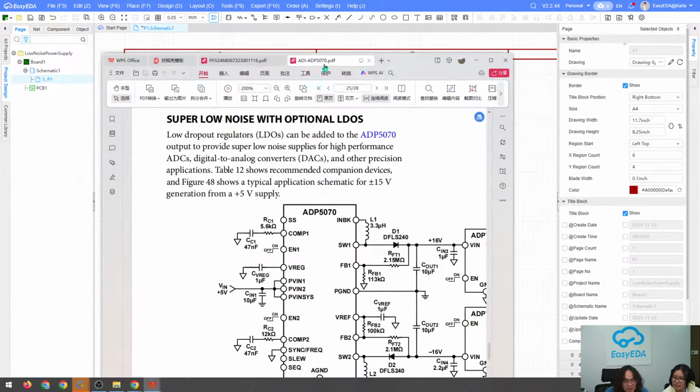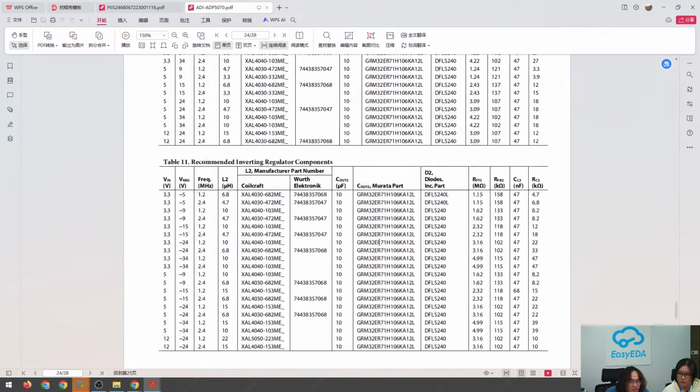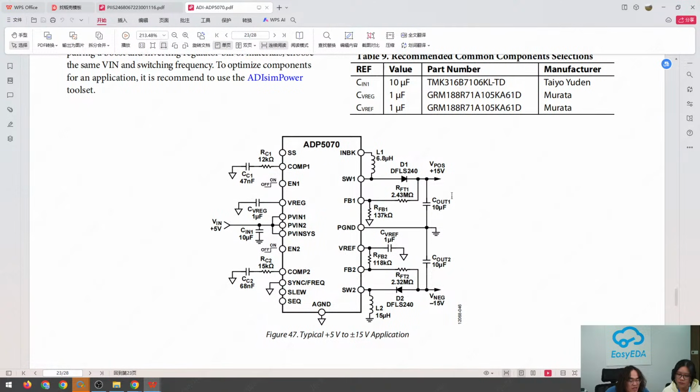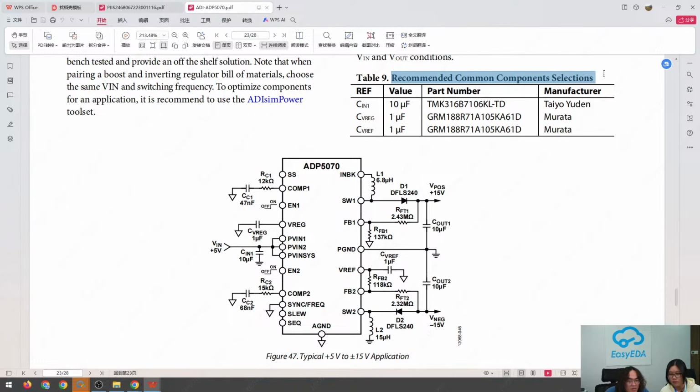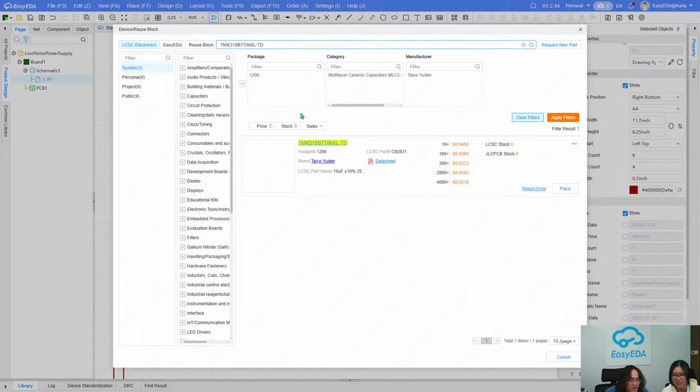When we replicate this schematic, I think maybe we can start from the input, like here. Actually, there are some special requirements, like we can replicate the schematic first in this part. So for the 5-volt input here, we have to place a C-in 1, and for the C-in 1 there is a recommended component from TMK. So we can try to place this component to search whether, oh yeah, it's available.